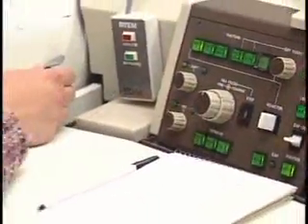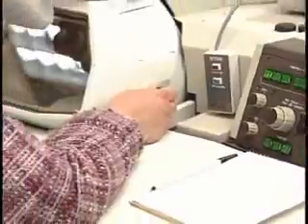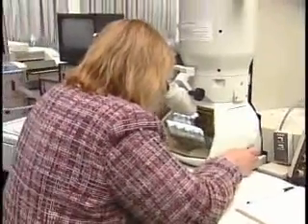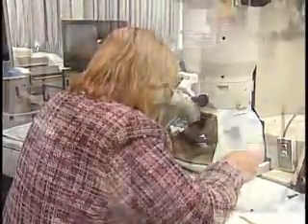Students might be using this to look at atomic arrangements, looking for defects in the stacking of the atoms. They might be looking for atoms that aren't supposed to be there — of some different elements, some other type. They might be looking at the atomic arrangement in a novel nanomaterial like carbon nanotubes. So it actually sees a lot of use for a wide variety of programs here, not just industrial support, because it is one of those only tools that can look at atomic arrangements.